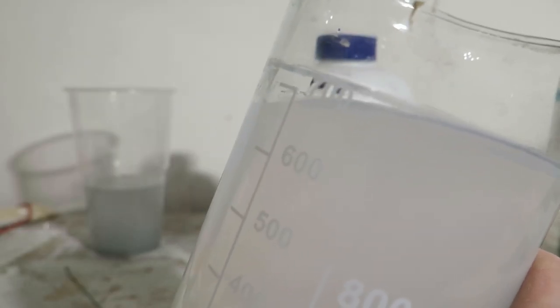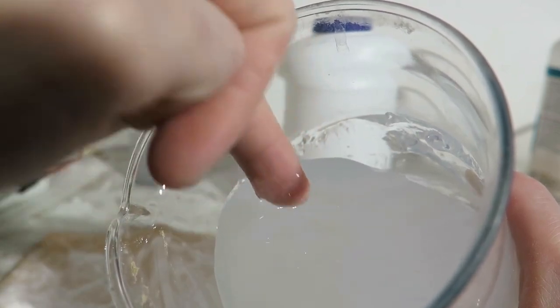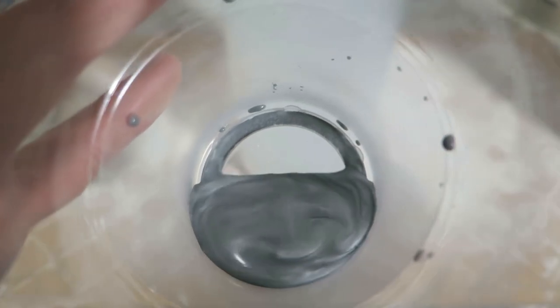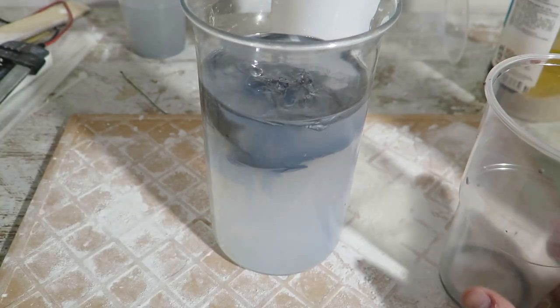So when the gel is done, it looks like this, it is gel. In this batch I have decided to add aluminium powder. It did not work at all, I mean, it had no effect, but I have to show it anyway because I have to explain somehow why my resulting material is black.